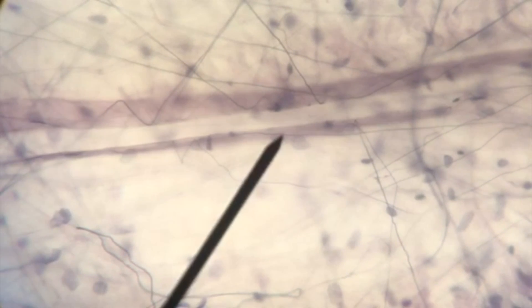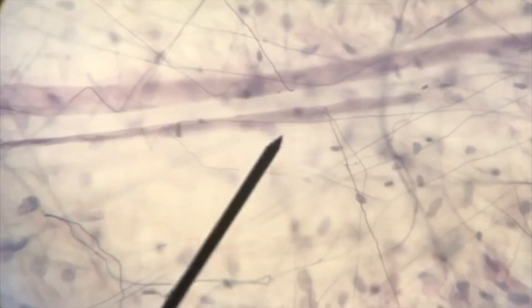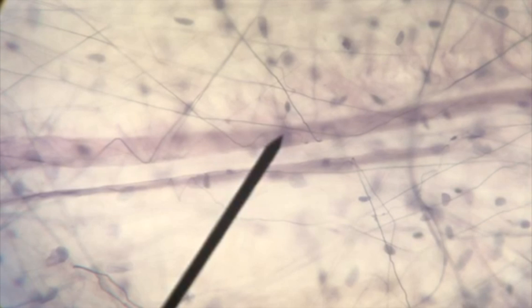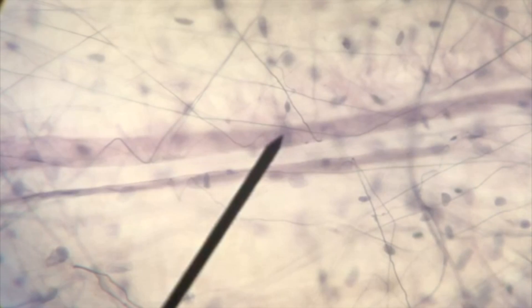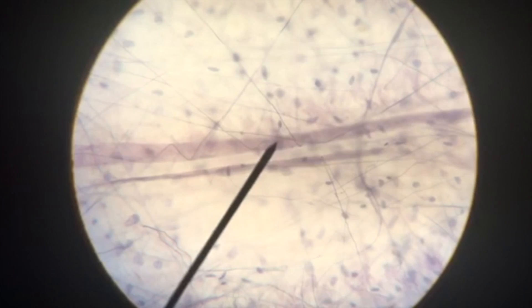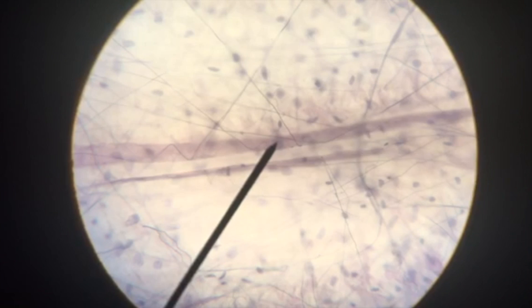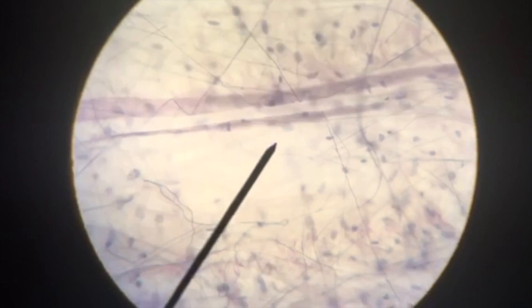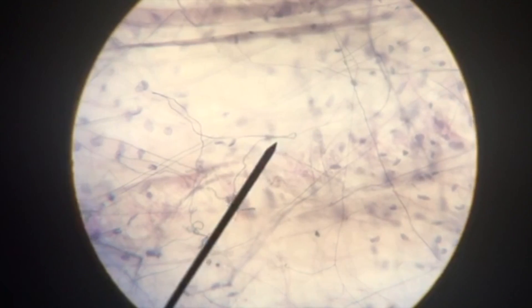We're going to switch gears now and shift to connective tissue. The first category we're going to look at is loose connective tissue proper, which includes areolar tissue, reticular tissue, and adipose. We're also going to look at dense irregular connective tissue and dense regular. The first tissue we have here is areolar. Notice that we have a lot of space in between our cells and fibers, which is different from epithelium, which was tightly packed with very little intercellular material. We're going to identify our connective tissue based on the fibers found within it.